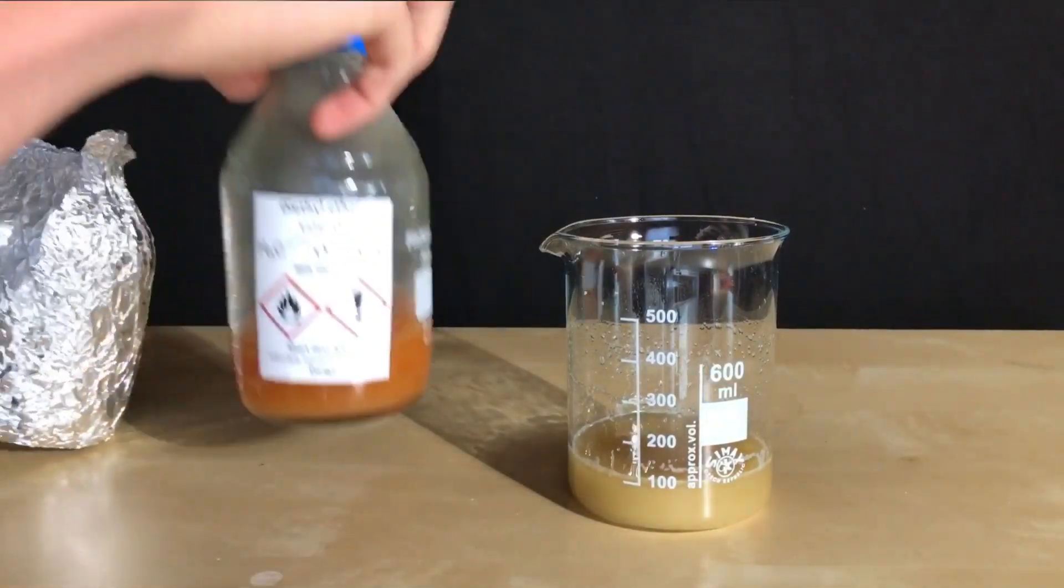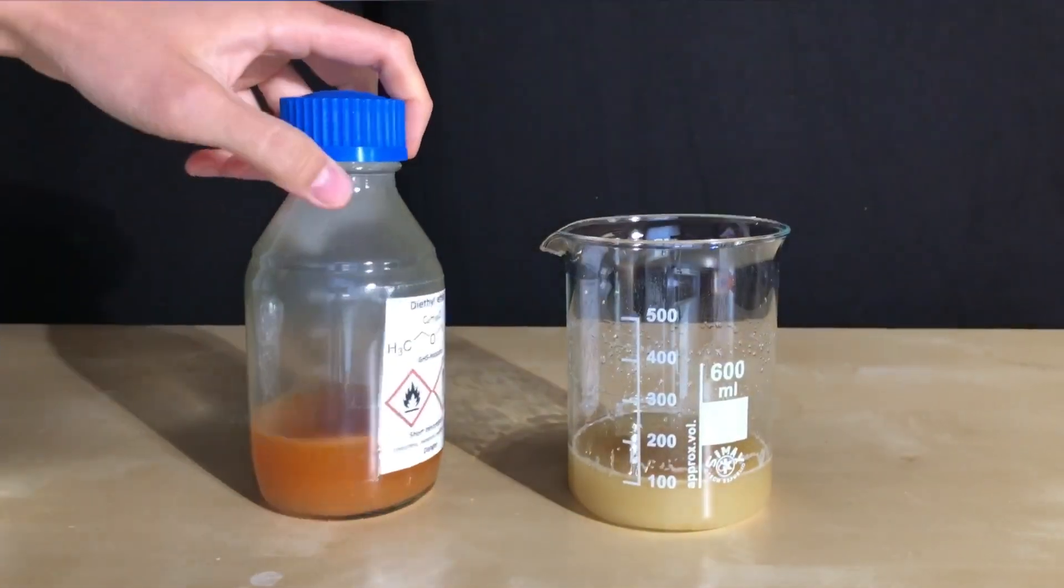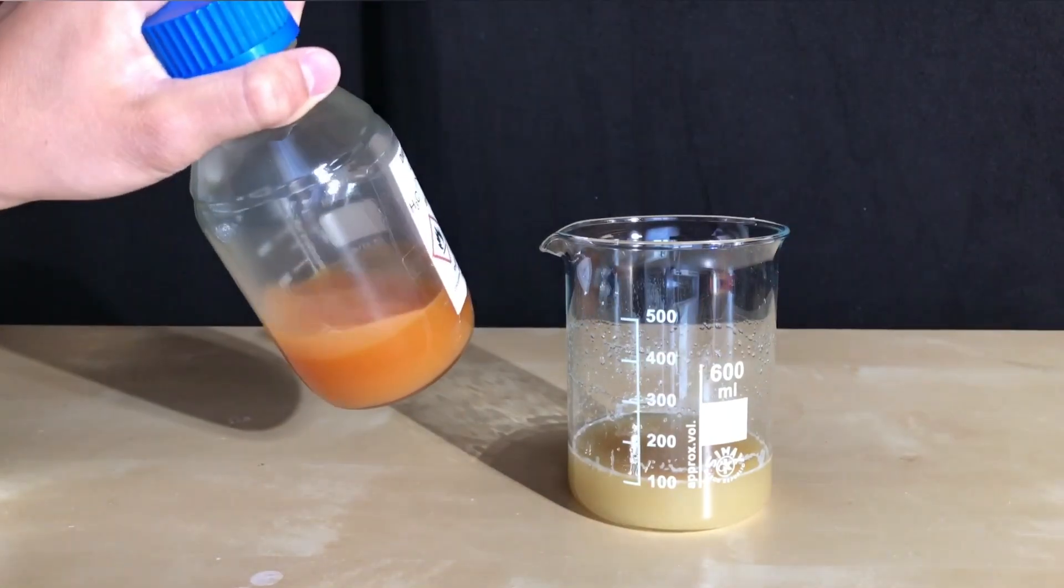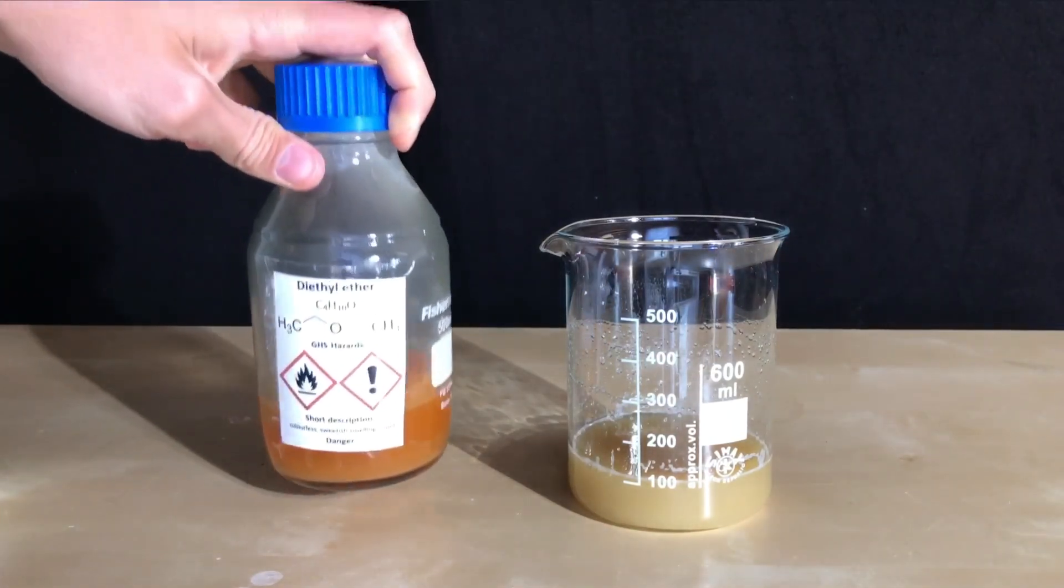For this, dirty ether and iron 2 sulfate solution are needed. The iron 2 sulfate might actually contain a lot of iron 3 sulfate, but it should be okay.